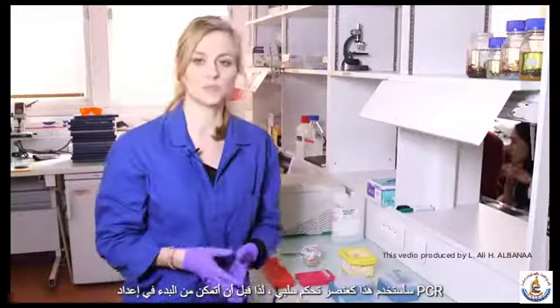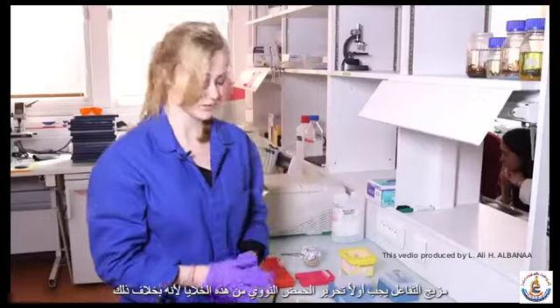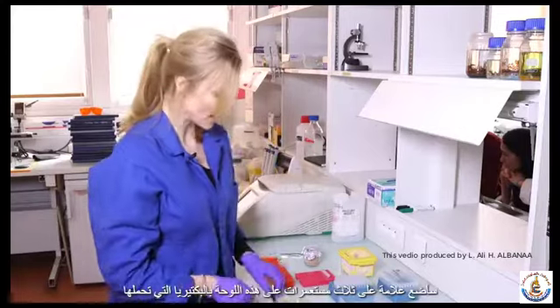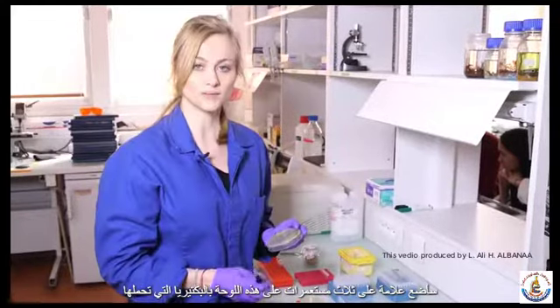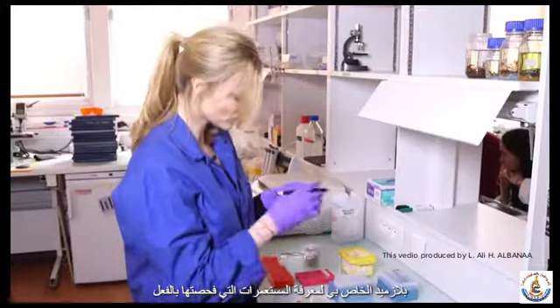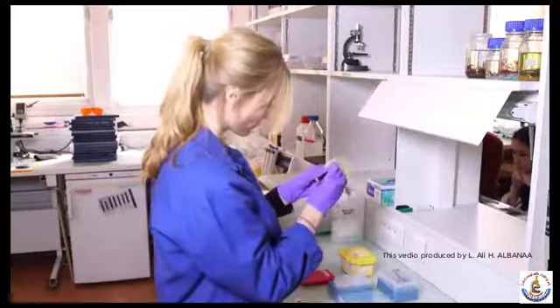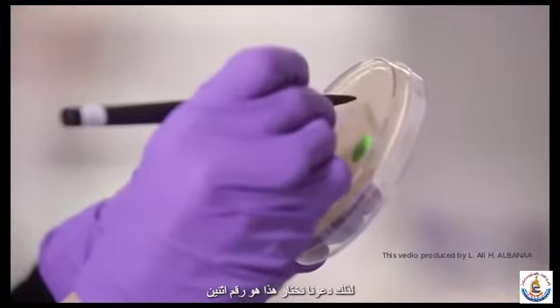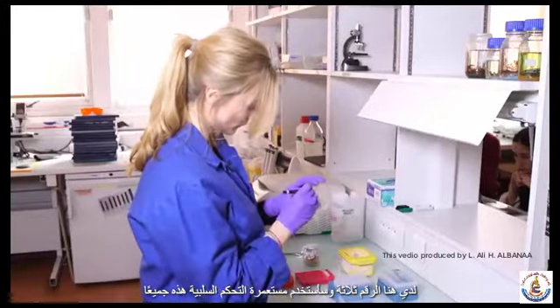So before I can start to prepare the PCR reaction mix, I first have to release the DNA from these cells, because otherwise they're not accessible for the polymerases that need to amplify the DNA. I'm going to mark 3 colonies on this plate with the bacteria that carry my plasmid to know which colonies I actually checked. So let's pick this one. This is number 2. And here I have number 3. And I'm going to use this negative control colony.